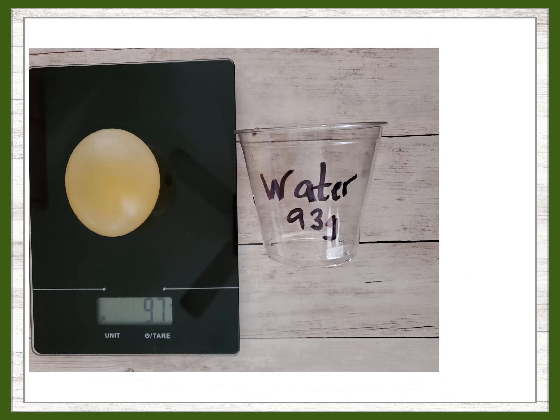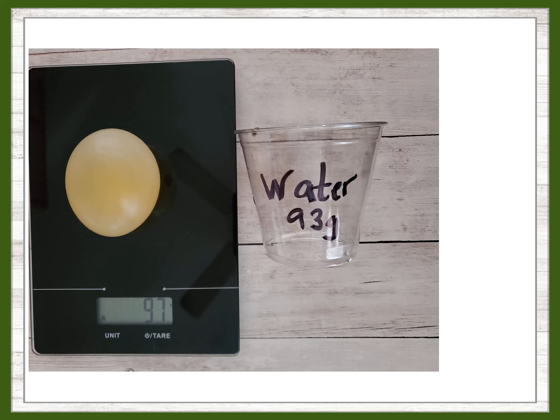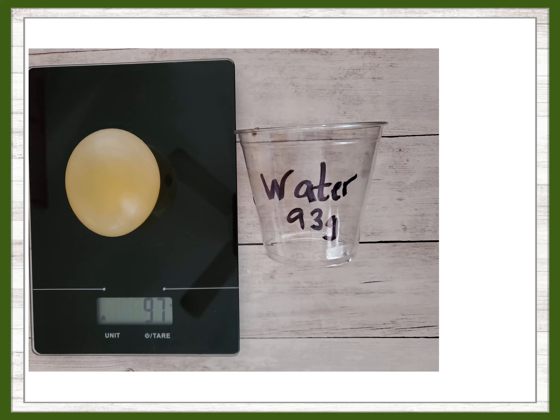Hi everyone. In this third part of our experiment, we will record the final masses of our eggs and compare the data.